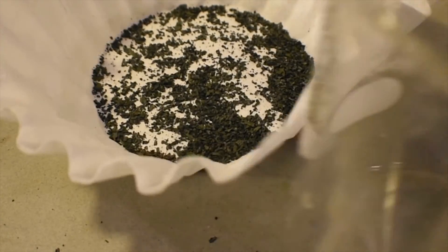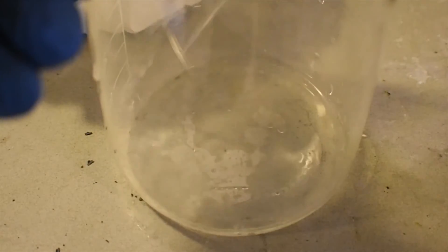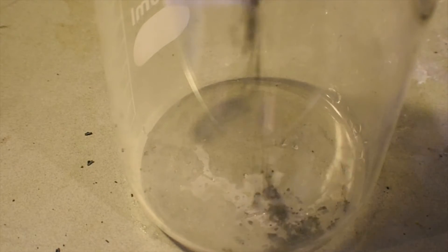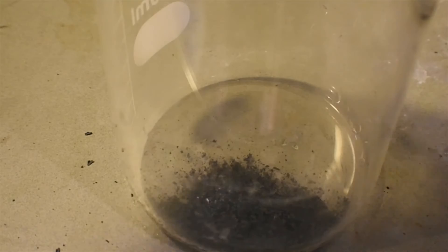What you're going to do now is unroll the mesh and scrape off the cadmium. For time's sake I'll skip ahead to that. Now we need to work fast: get a beaker, add about half a centimeter of distilled water, and add the cadmium to it. The purpose is to prevent the cadmium from oxidizing — it's a very fine powder, and left out in air it is pyrophoric to an extent; it will turn brown with the formation of cadmium monoxide. We don't want that, so we keep it under water to protect it from oxidation.